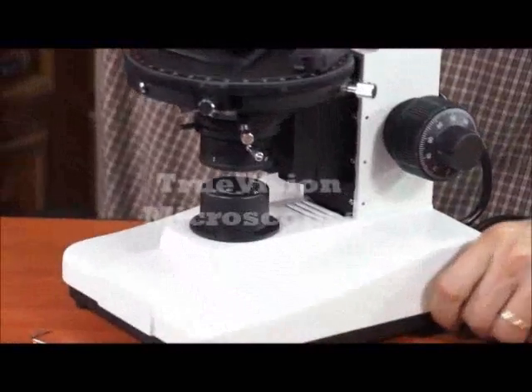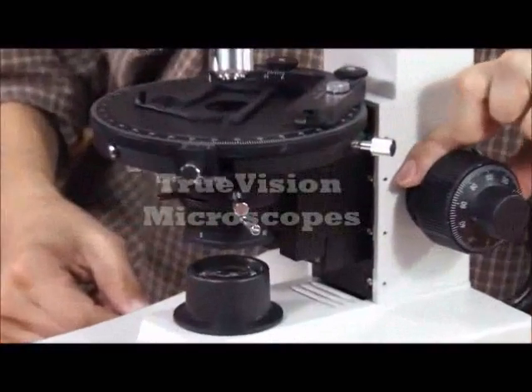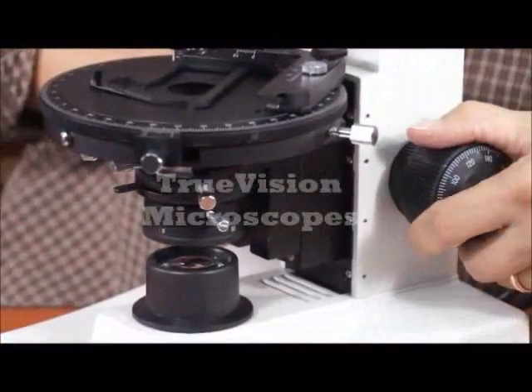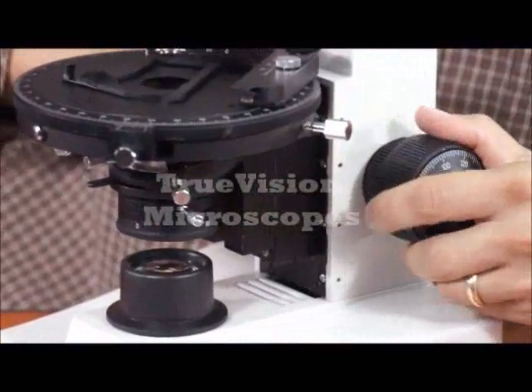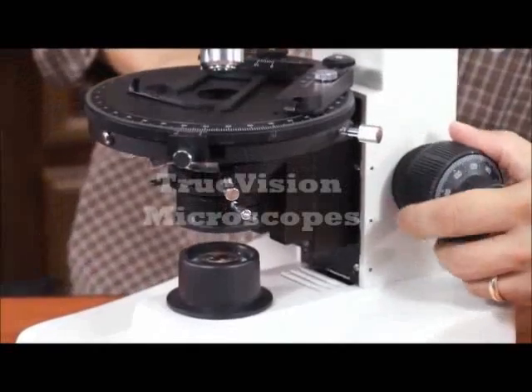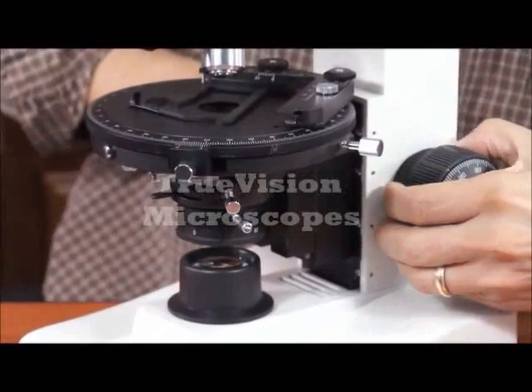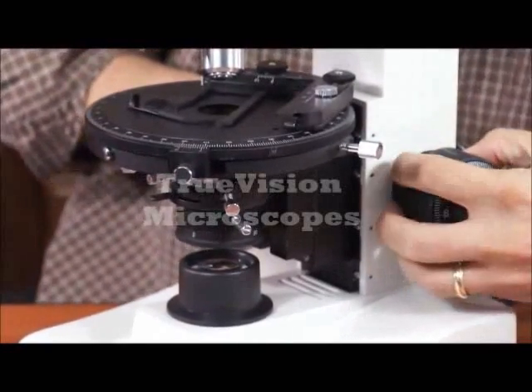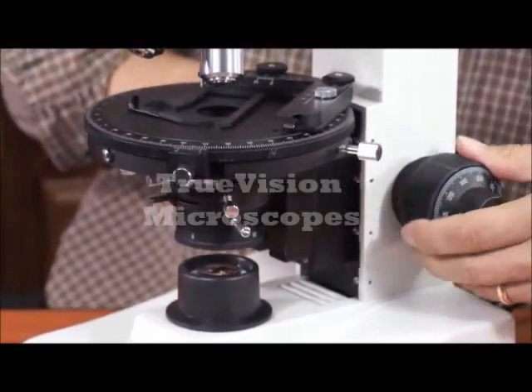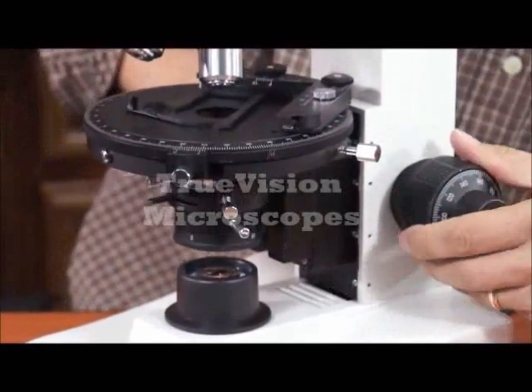It also has coarse focusing tension. Turning it in this direction will make the coarse focusing tension greater. Releasing it by turning it counterclockwise makes turning the coarse focusing easier.